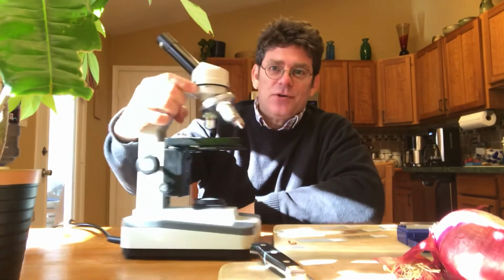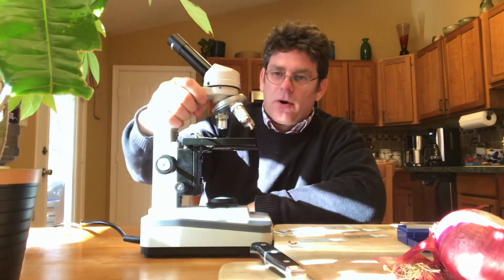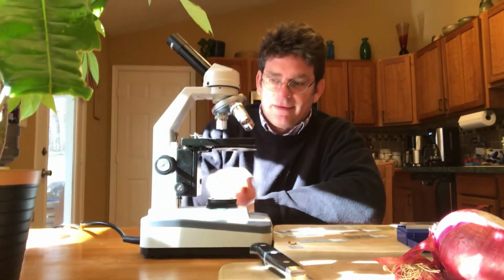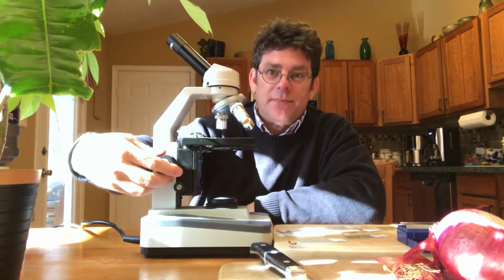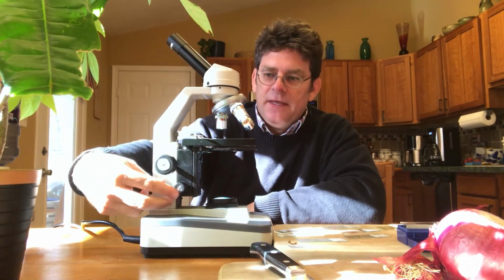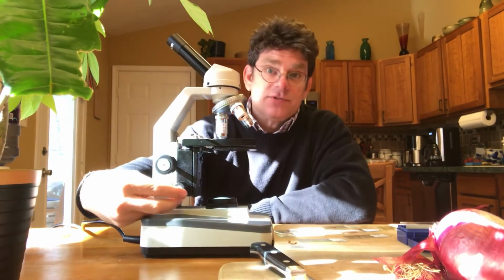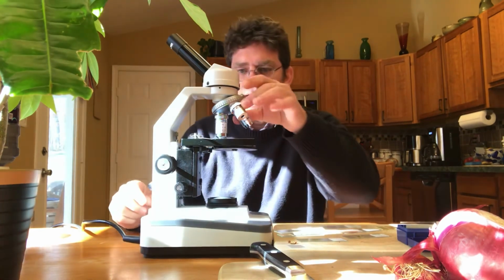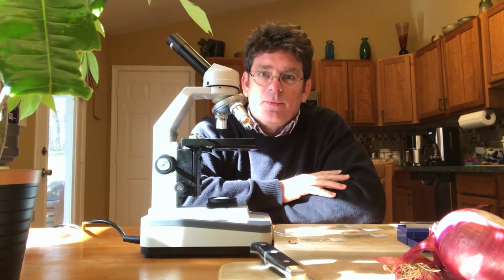Again, a compound light microscope, some of the parts real fast: eyepiece, objective lens, arm, base, light, stage. Right, most of the names mean what they say. Coarse adjustment knob just moves things very coarsely or very quickly. Fine adjustment knob. And again, the only real rule is on high power, use the fine adjustment knob so we're not cracking any slides. Again, hopefully I have a bunch of different slides and things we can look at when we get back to school.